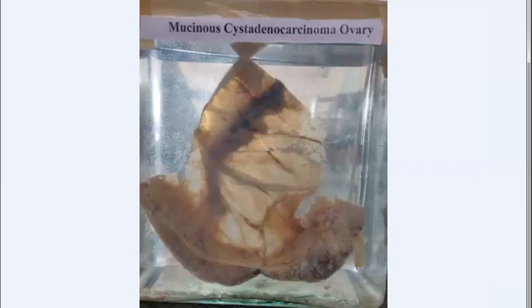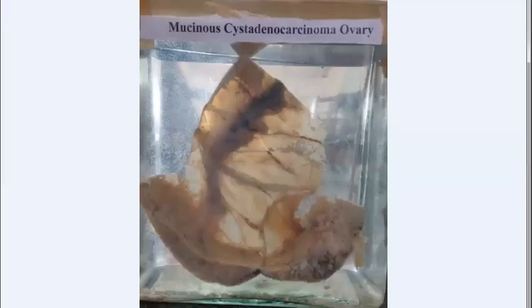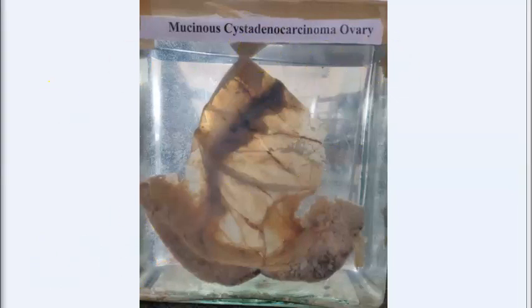Mucinous cystadenocarcinoma — an epithelial tumor of the ovary. It is larger than the serous type, with a smooth surface and characteristic multiloculation containing thick, viscid, gelatinous fluid. The malignant variety has thick septa.